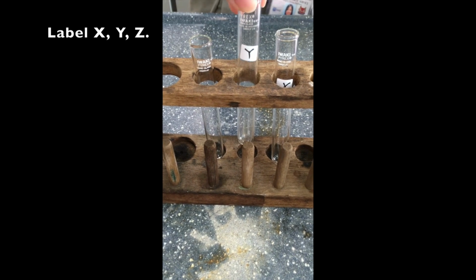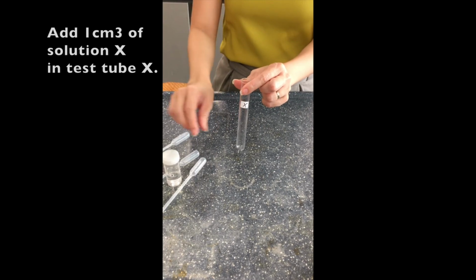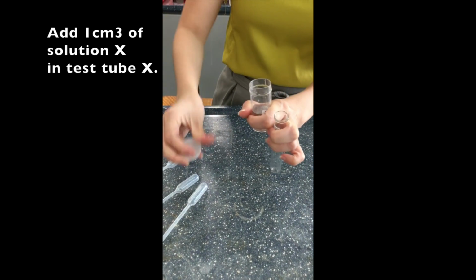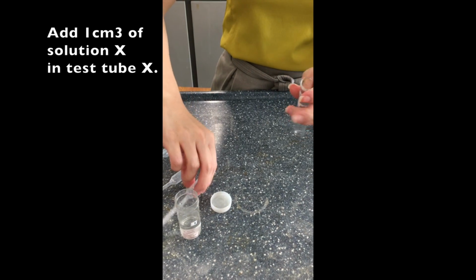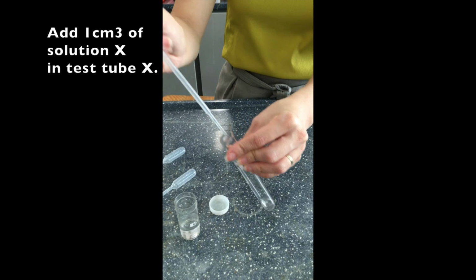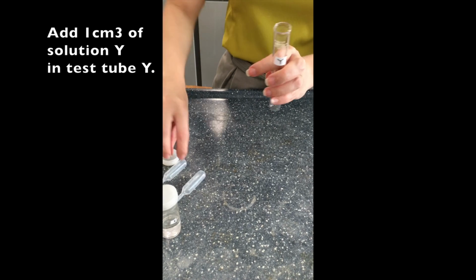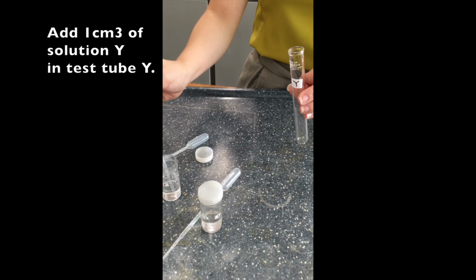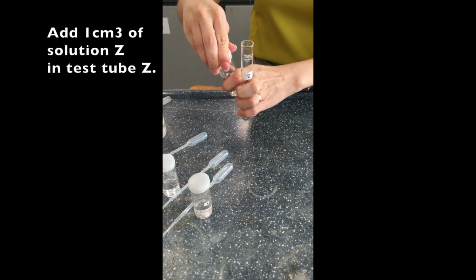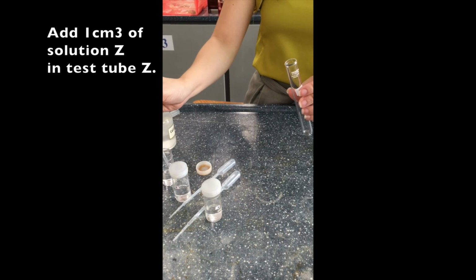Okay, so here we are labeling the test tubes X, Y, and Z. Then we add 1 cubic centimeters of solution X into test tube X. So this is about 1 pump. We do the same for Y. So we add 1 cubic centimeters, which is about 1 pump of solution Y into test tube Y. And we do the same for solution Z into test tube Z.